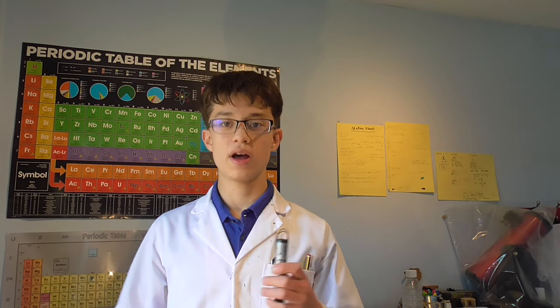So, the chemical I want to make is copper acetate. Copper acetate is usually used as a fungicide, but the main reason why I want to make it is just because it looks nice.